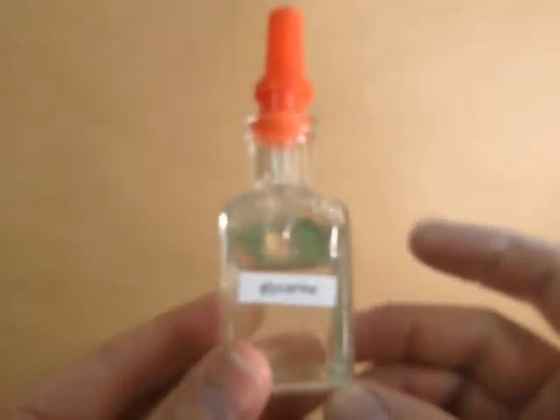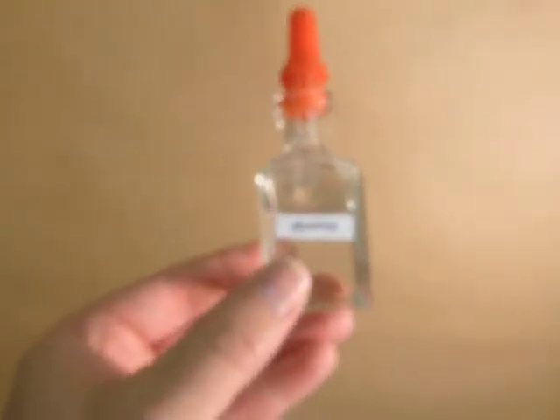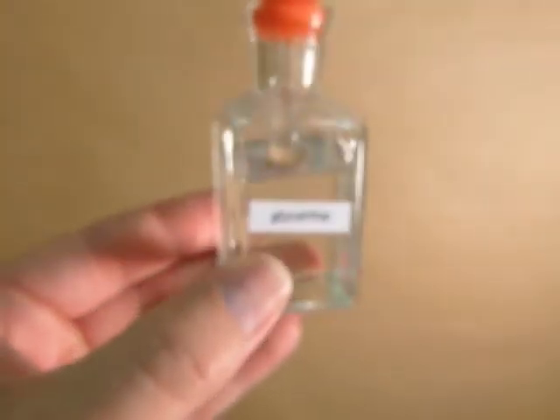When you work with the other molecules that you'll be doing, watch out for glycerin. Glycerin is a very, very thick and goopy substance, so it doesn't mix very well just because of its goopiness. Make sure when you use this one that you cover the tube with a finger and shake it really a lot, and then give that time to sit so that it can settle if it's going to mix or not.